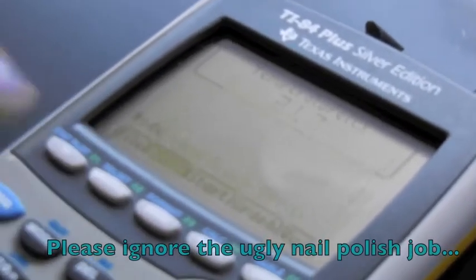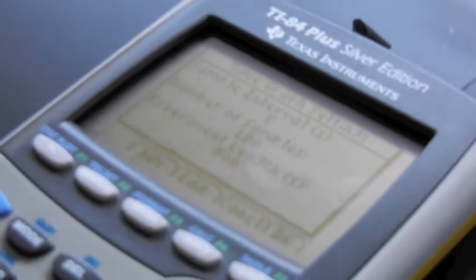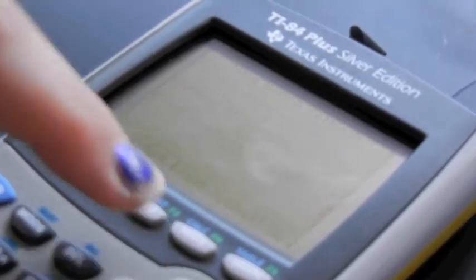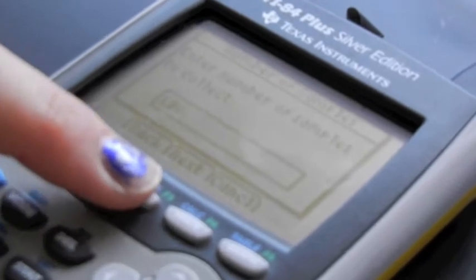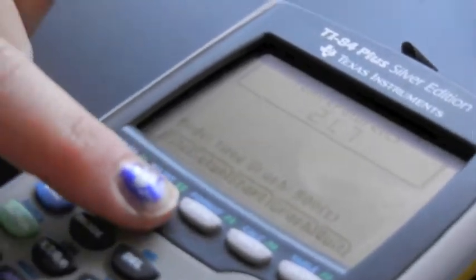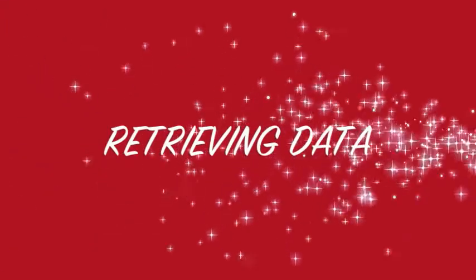So you go to Setup, Time Graph, and we're doing every 5 seconds for 180 seconds, which is 3 minutes. So you go to Edit, every 5 seconds, next, and for 180 seconds, next. Then you press OK, and when you're ready to record your temperatures, you press Start.